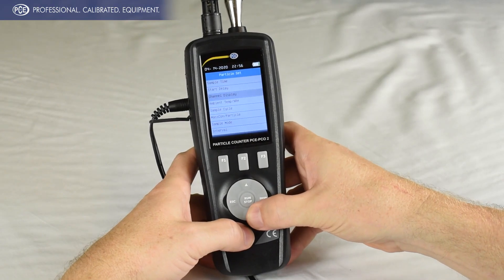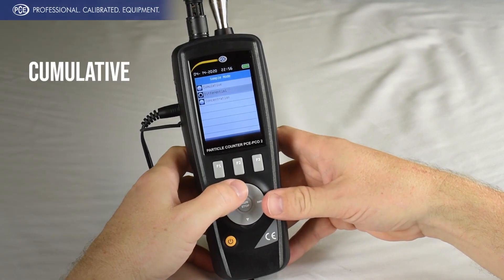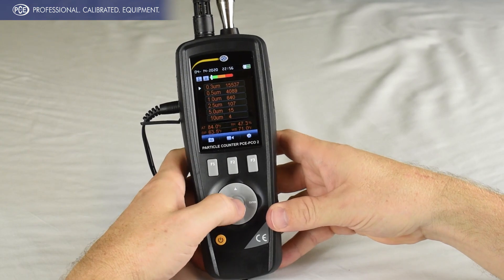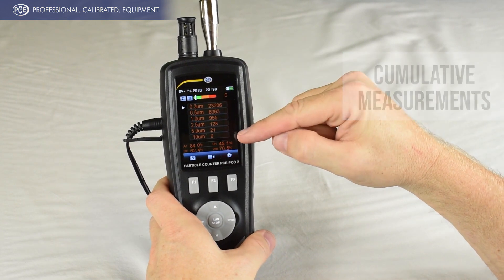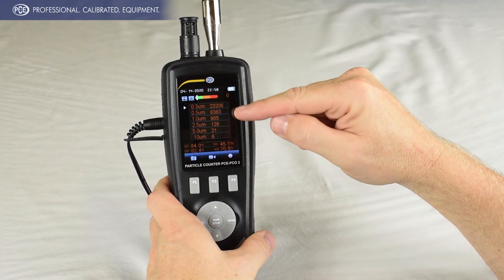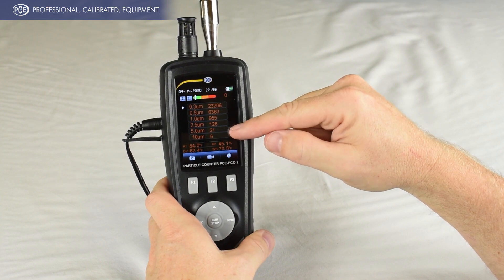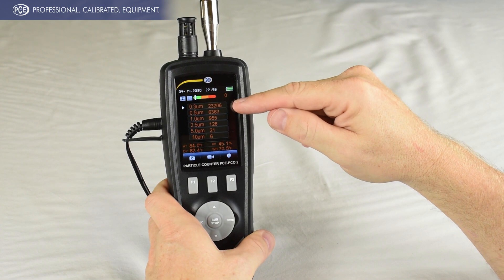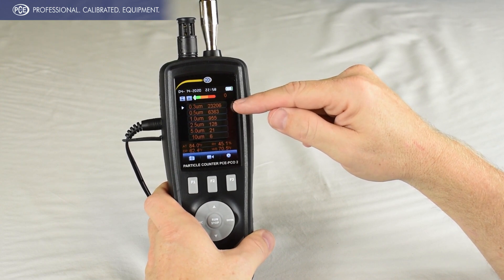For the next sample we're going to switch the sample modes and go to cumulative. In the cumulative mode, each channel is being added — the total is being added to the next channel. So 10 microns is added to what the 5 micron total is, and it combines those all the way up. That's why you see the numbers are greater in the cumulative mode than the differential mode.